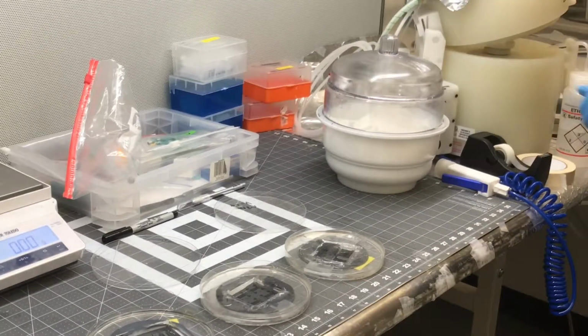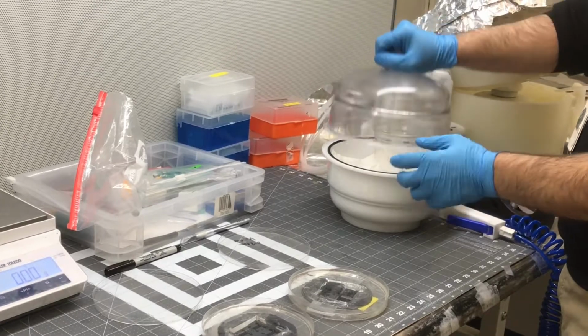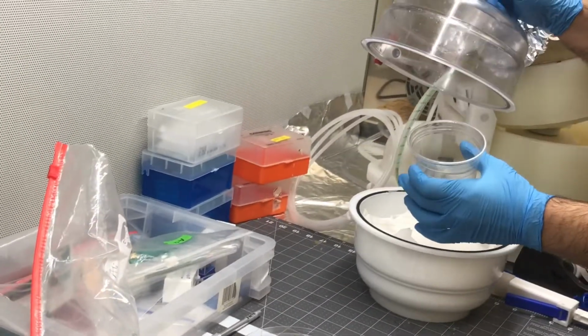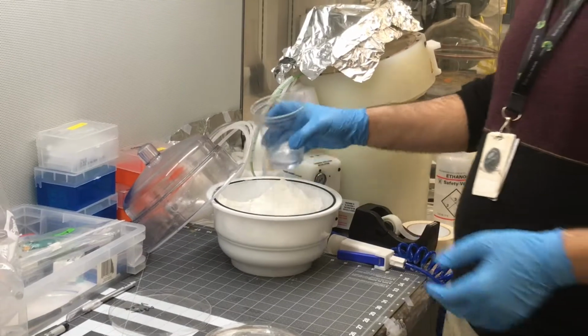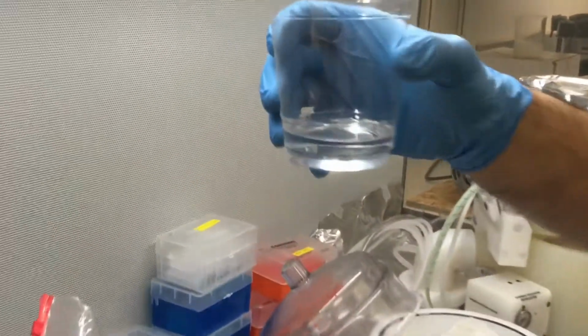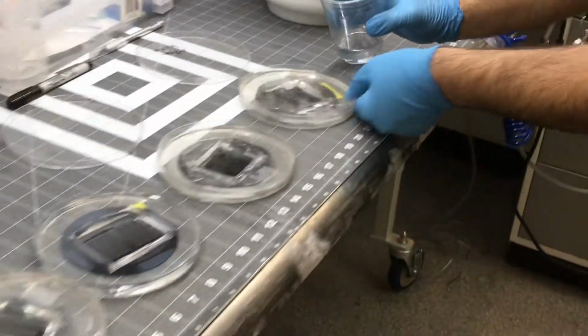Now Ali is taking it out. Now we remove it. For removing, be careful when you open the air. Be careful that everything does not fall in. As you can see here, it's completely transparent. Now immediately you should do this part fast.